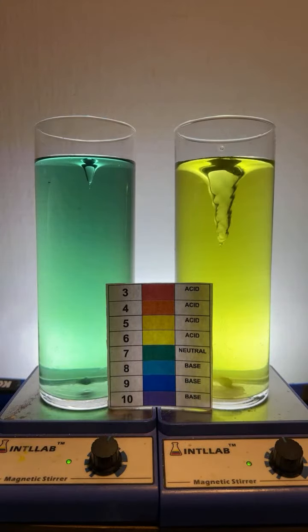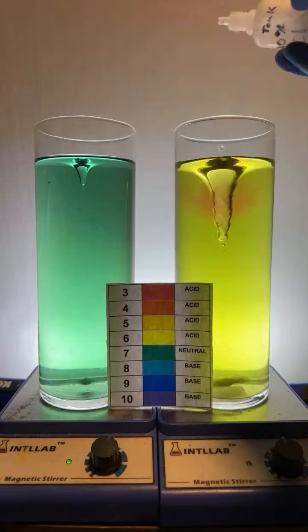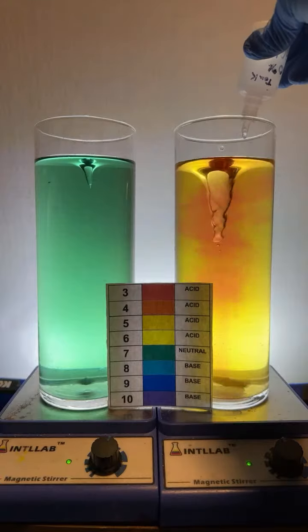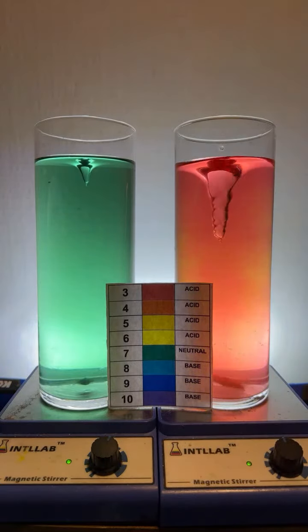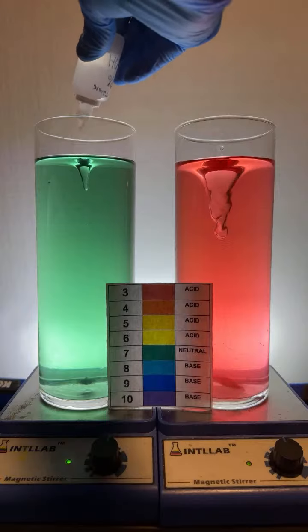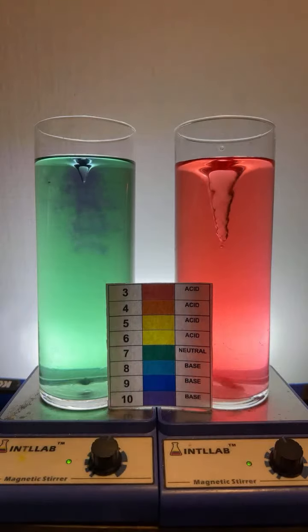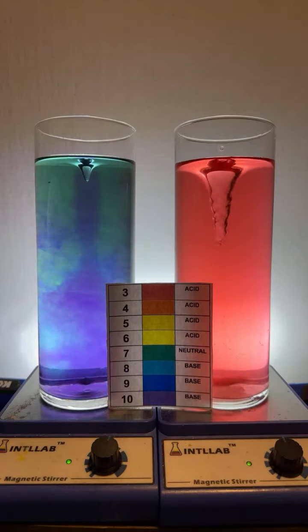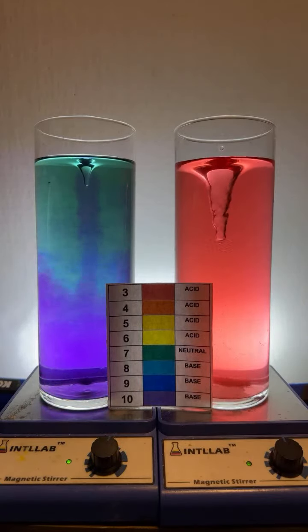You got it there, Commando. And what I am adding, like right now, I'm adding 20% by weight hydrochloric acid over here on the flask on the right. And over here on the left, I'm adding 20% by weight sodium hydroxide. Orange, the temperature of the water is also room temp, about 20 degrees Celsius.